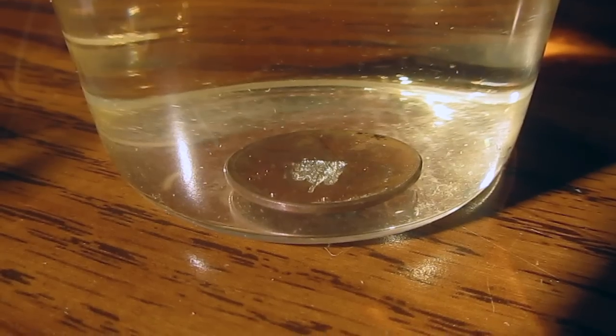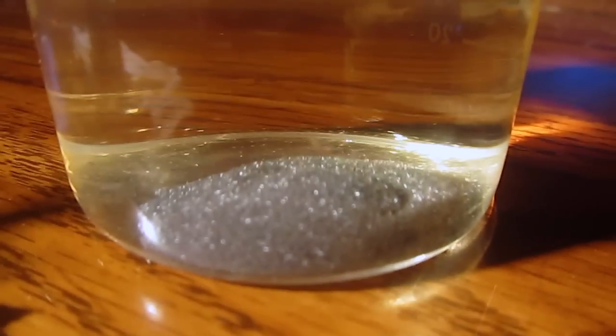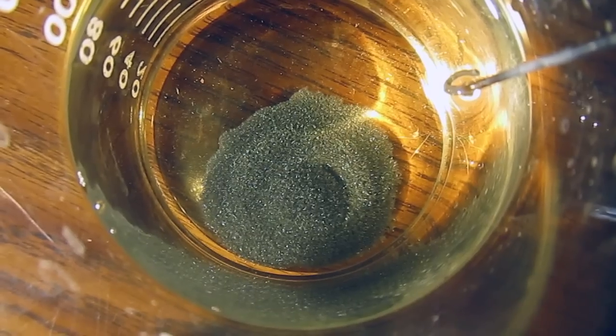I tried this again with a penny on the bottom of the beaker, but instead of growing up, it just forms a flat mass of small crystals.